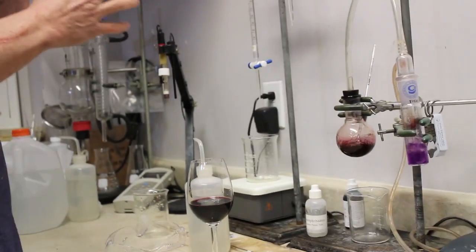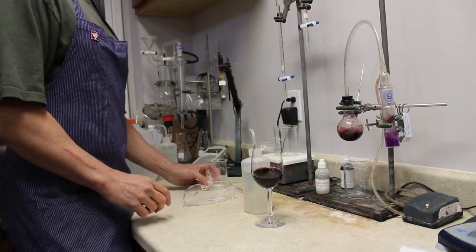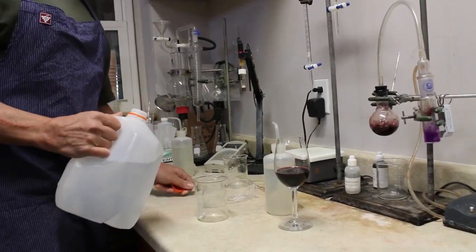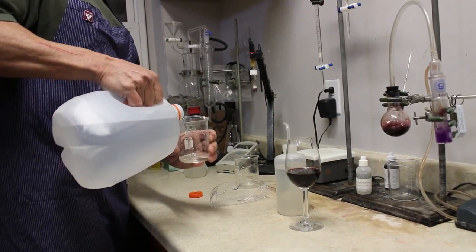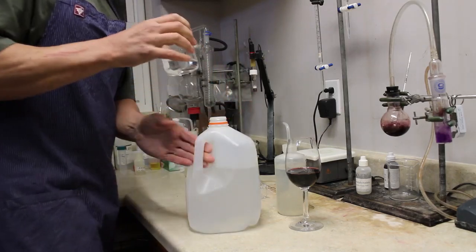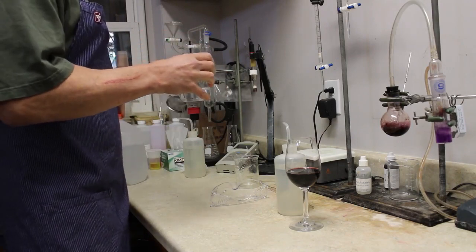What we're going to be doing today is looking at TA. TA is titratable acidity, as I said before. So the way we do that is we have to start with a little bit of water in our flask. Now that's distilled water, right? This is distilled water. And this part is really not critical because the water doesn't change the acid.